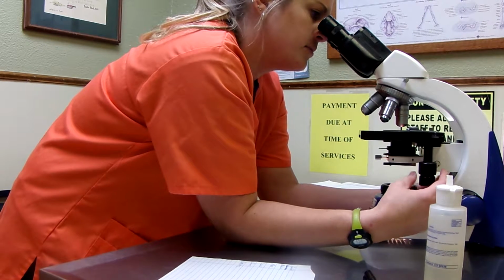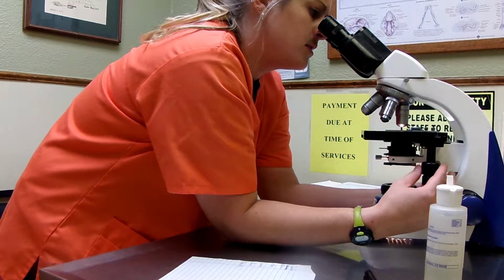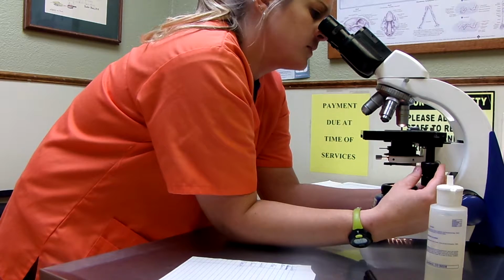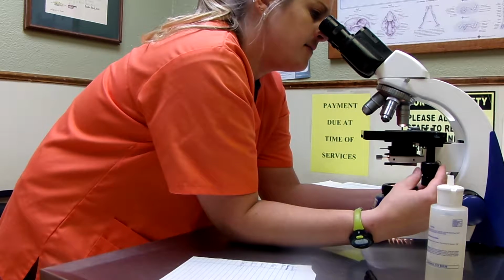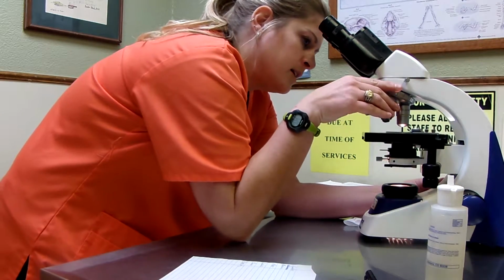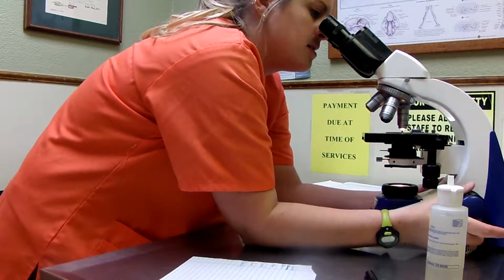Okay, so I'm going to pop back over here in this region, get closer to our feathered edge, kind of the counting area, looking at all that. Okay, so our staining's adequate. Going to go ahead and go down to the 40, or up to, I guess you could say.